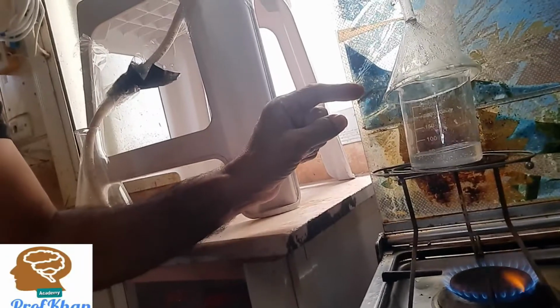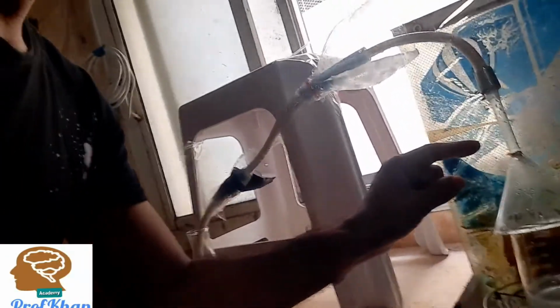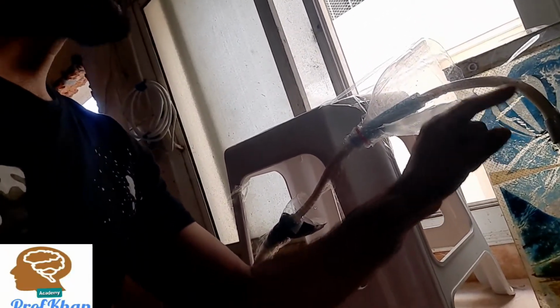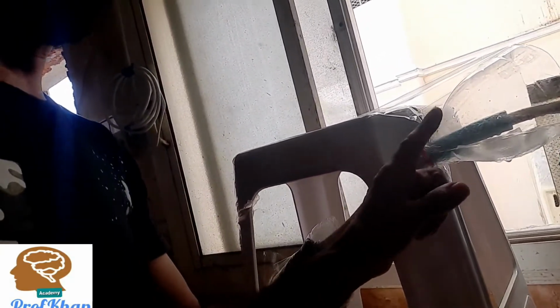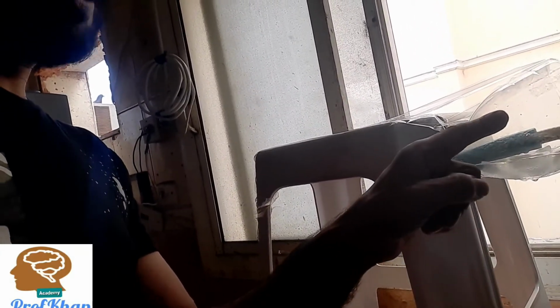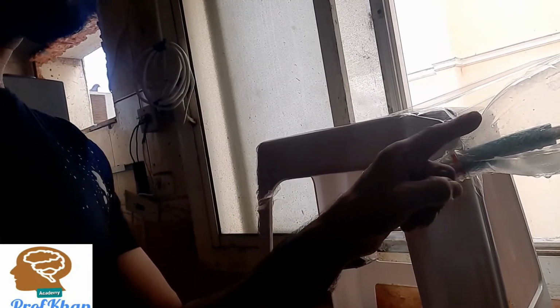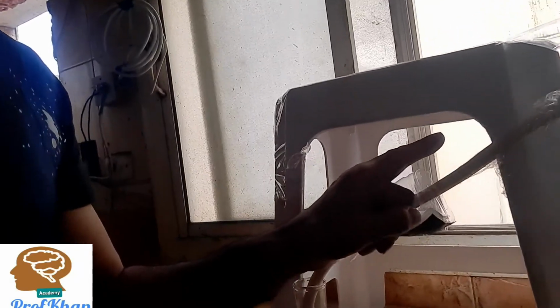So a lot of gas is going to be produced, and this gas is moving up into the funnel. From the funnel, you can find this is made by me something like a delivery tube. From this delivery tube, this section has ice cubes, which is something like a condenser. It will make the vapors cool, and then the vapors will be converted to liquid and move through this tube.